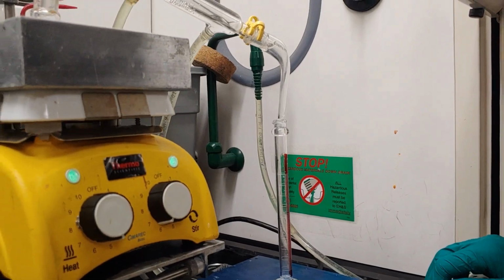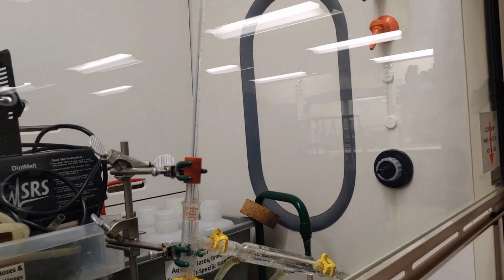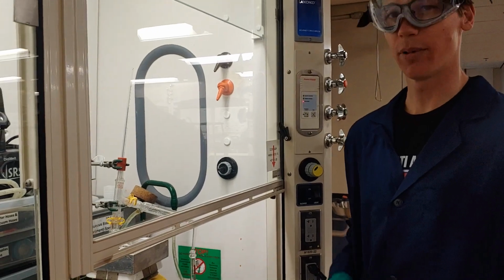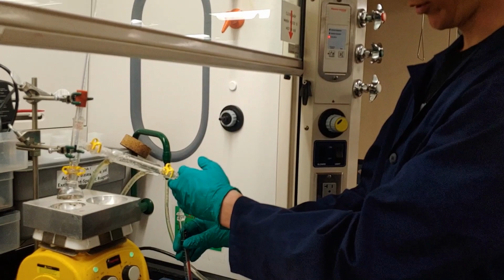we'll pull that off. At this point, it's still about 77 degrees, and why might that be? If you compare that to the boiling point of your alkene product, what might be the reason for those temperature differences? So at this point, we are done with our distillation.